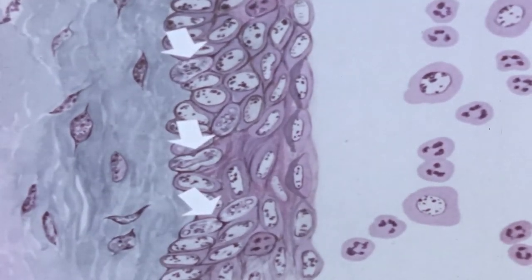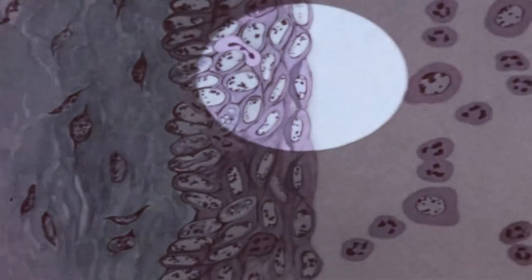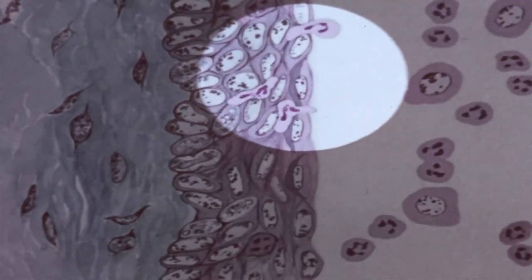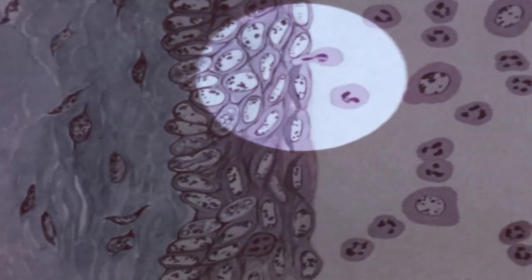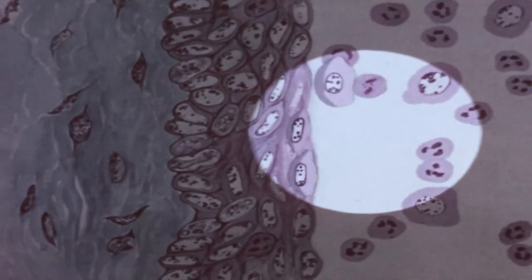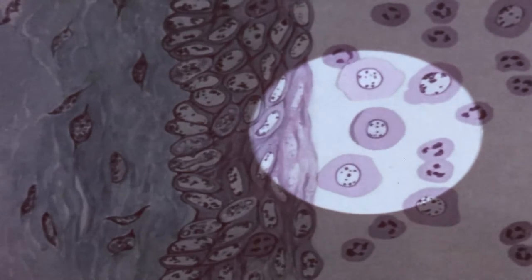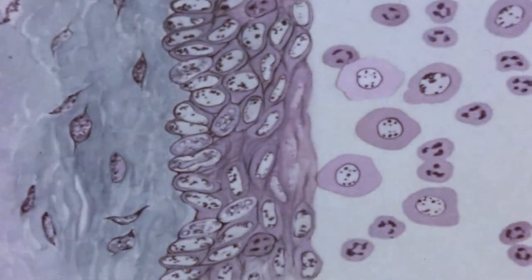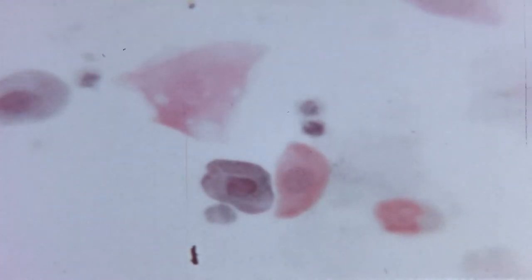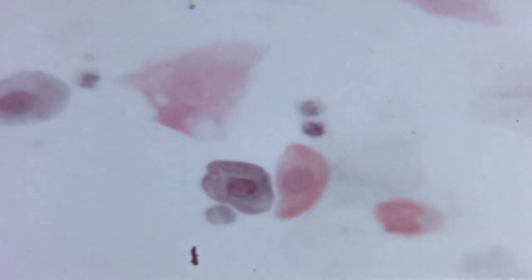The epithelium is composed of several layers of cells, and the number of cell layers increases rapidly by mitotic division. At this time of the cycle, leukocytes are making their way through the epithelium and into the lumen of the vaginal canal. Cells sloughed from the surface in making the smear are round and nucleated. An actual smear made at this time shows both nucleated epithelial cells and leukocytes.